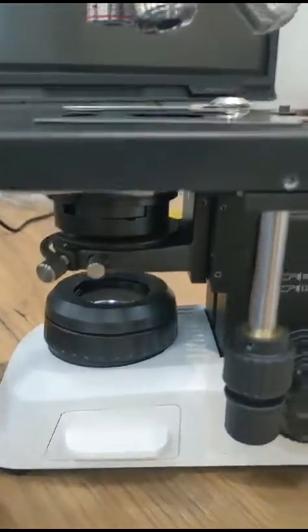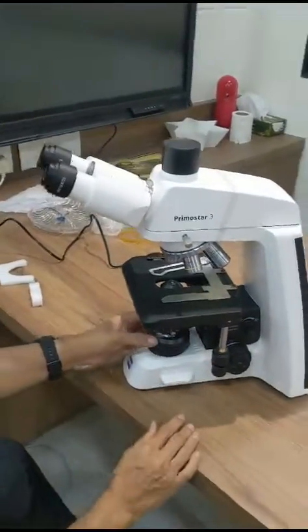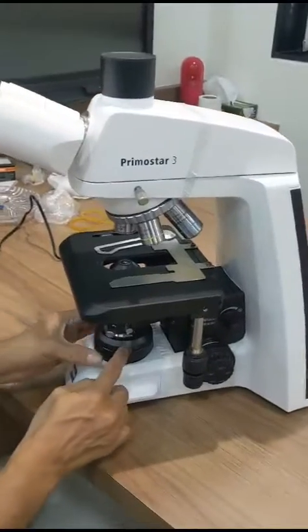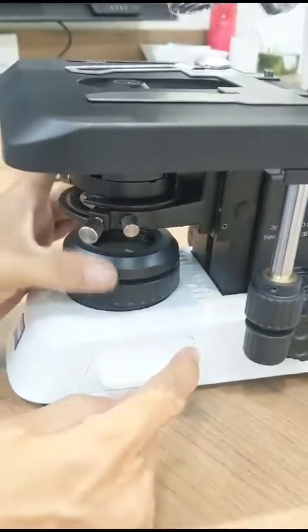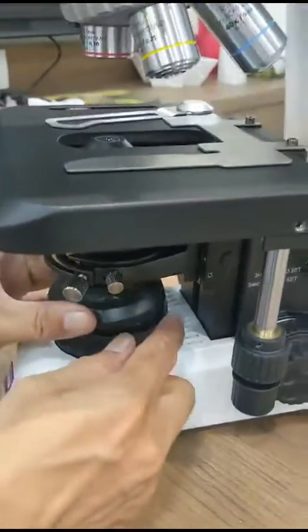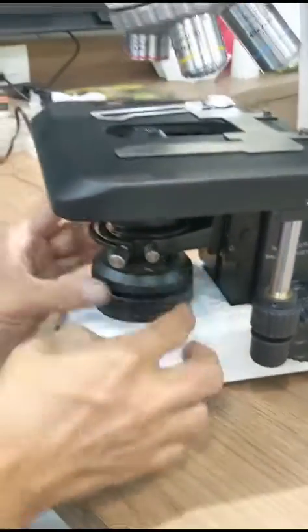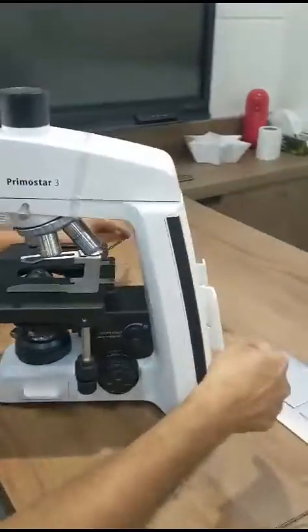Remember to remove this particular packing by taking the stage up. Remove the packing, and also remove this packing. Now the microscope is without packing. This is the ring — unscrew this and put a blue filter here if available, then just put this ring back.